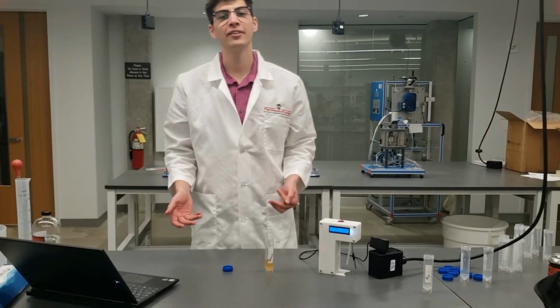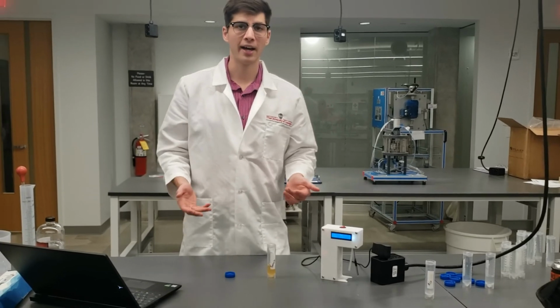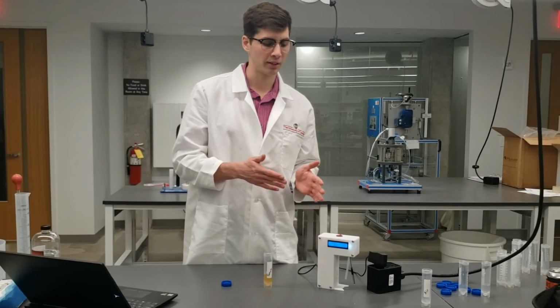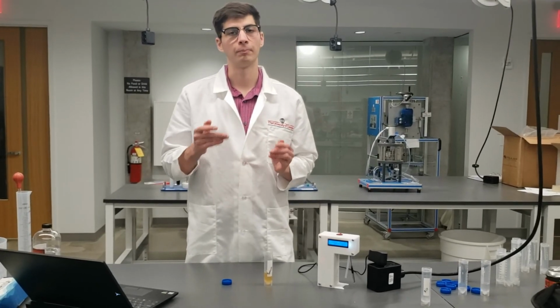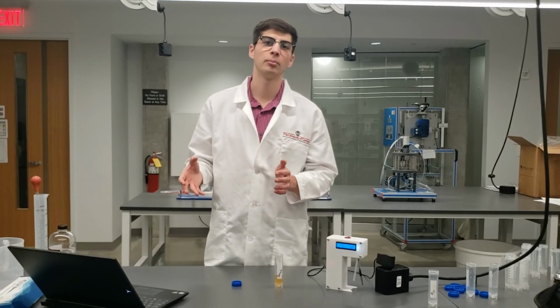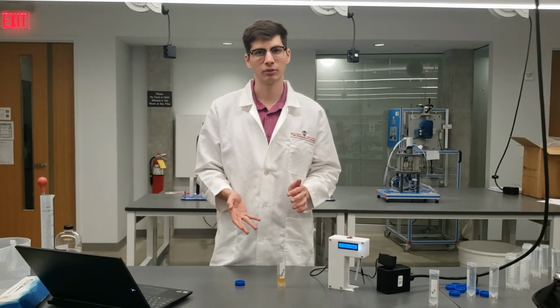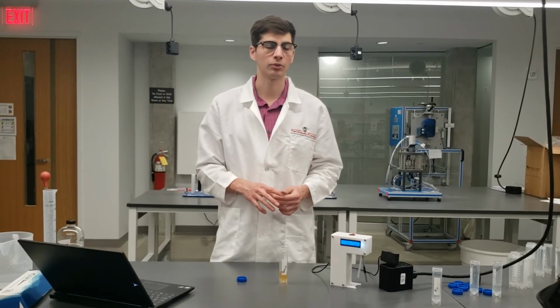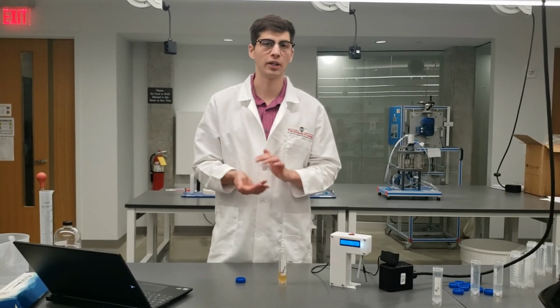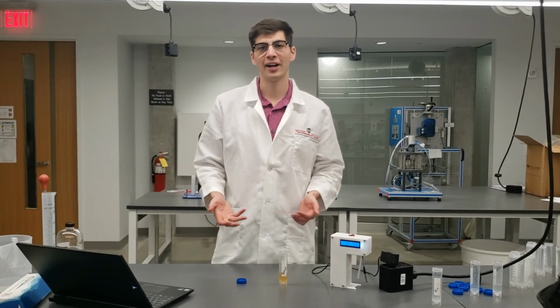Okay, so you can see even the slightly more complicated version of using this detector is really not that bad at all. Most of the work comes in preparing the 5 different alcohol standards. Once you prepare your dilutions, you have a storage of them in the fridge, and you can just pull them out whenever you need them. And running all of those standards only took me about 5 or 10 minutes. So preparation of the standard curve only takes about 5 or 10 minutes, and you get much better accuracy with the detector. I hope this video has been helpful.